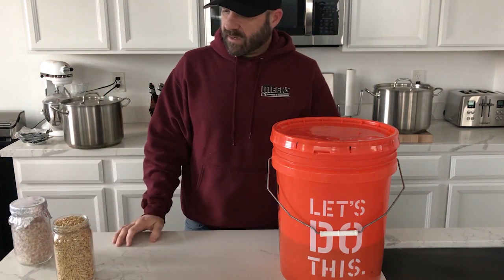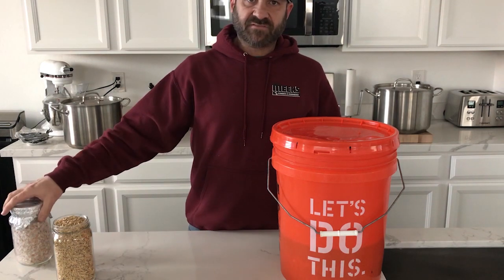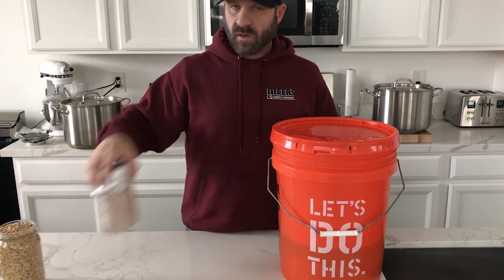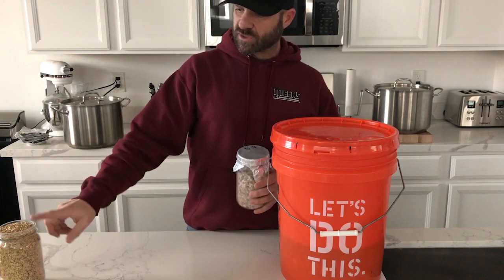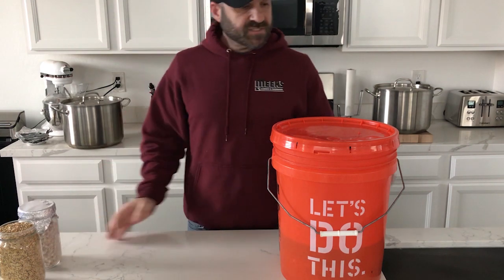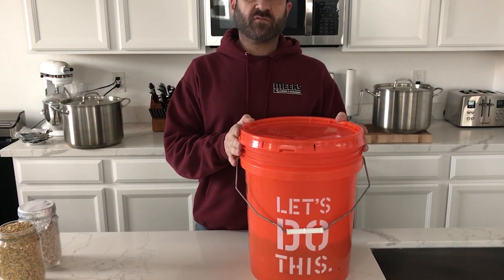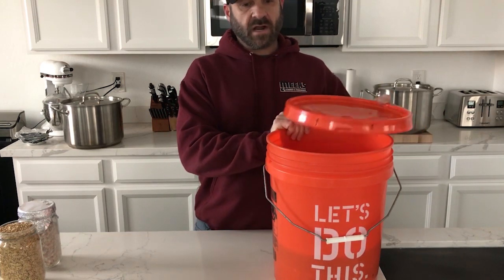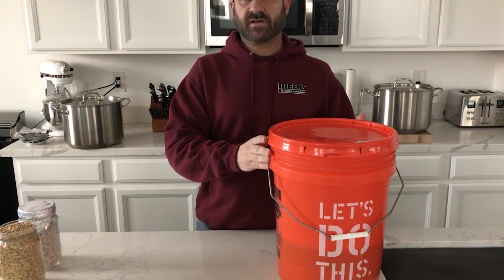With this technique though, my grain is stretching further - one dry quart jar is actually filling up four hydrated jars, so if I'm doing four jars I'm getting 16 full quart jars. The big difference is I used to just do a 24-hour soak of my grain in a bucket like this, then put it through its process of drying off and pressure cooking.